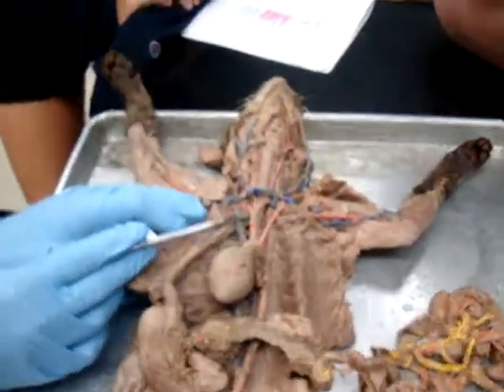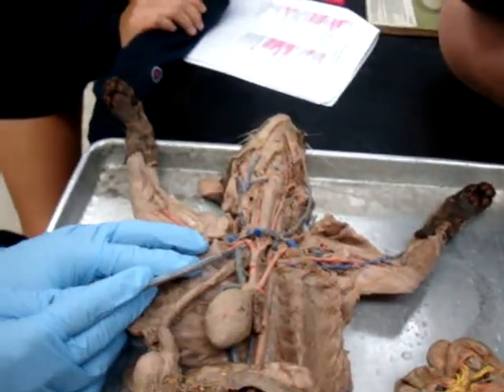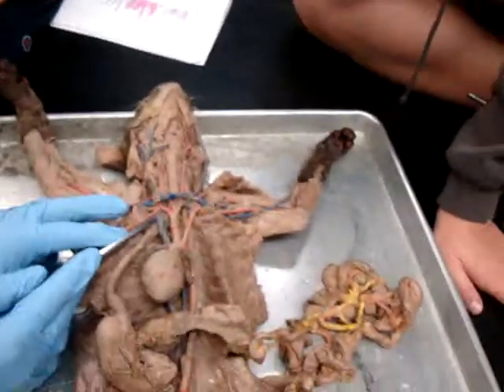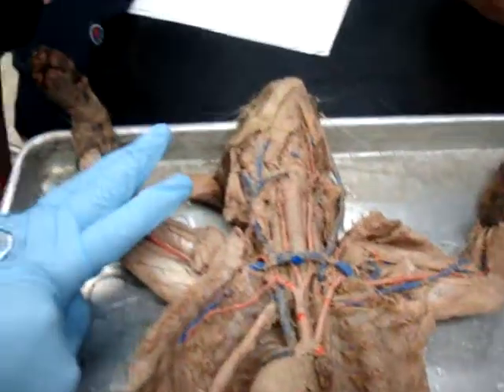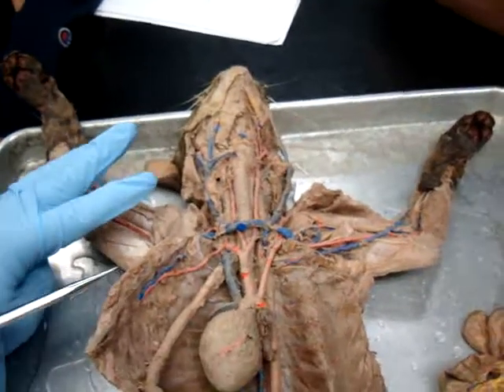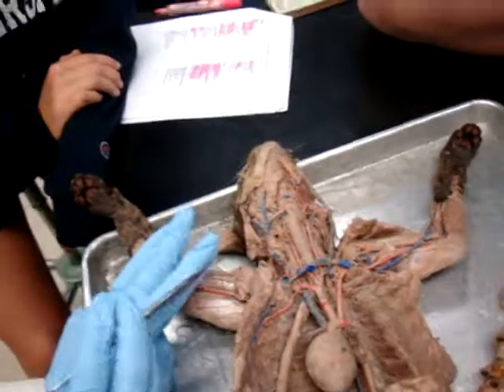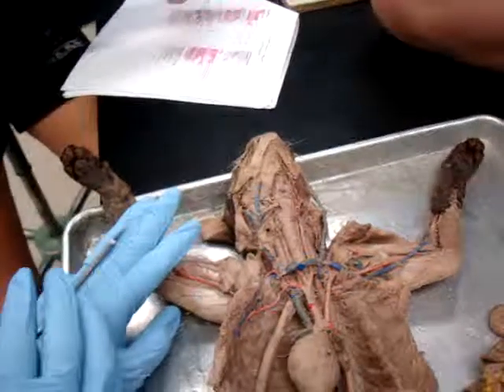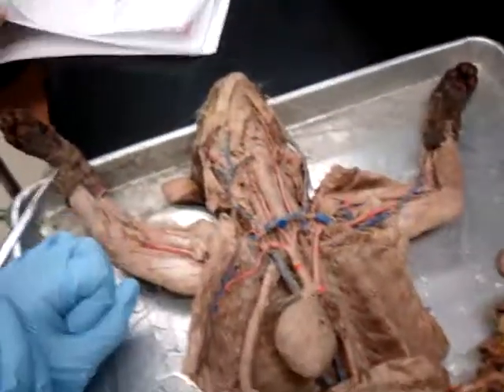Coming off of our brachiocephalic trunk, we're now going to have our subclavian arteries. Here's the right subclavian. Subclavian has 4 branches that you need to look for. We've got 3 going this way and 1 going down like this. The 3 in this order are going to be different, whether you're looking at a human or a cat. So, cat first. Cat is V, C, T, because in the word cat, C comes before T, and in the mnemonic, C comes before T. And human is VTC.